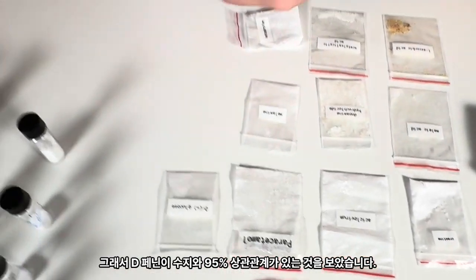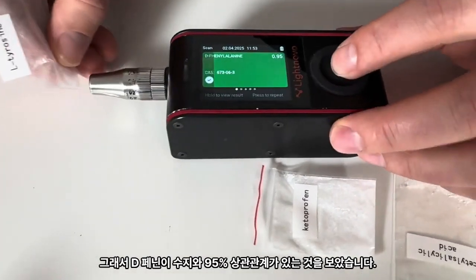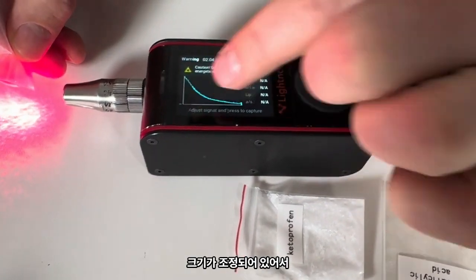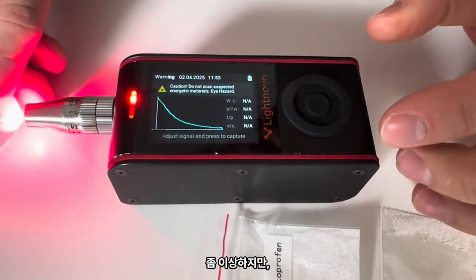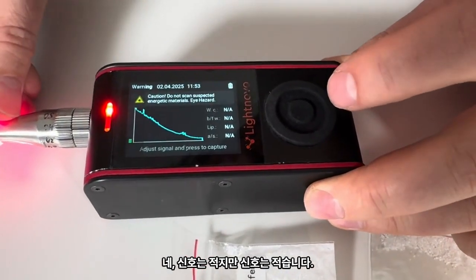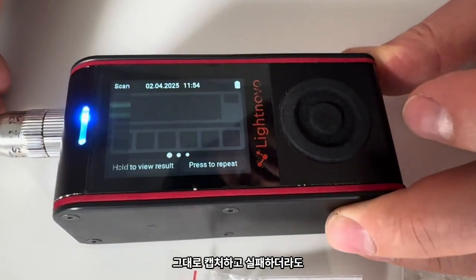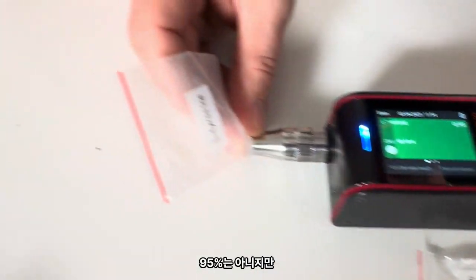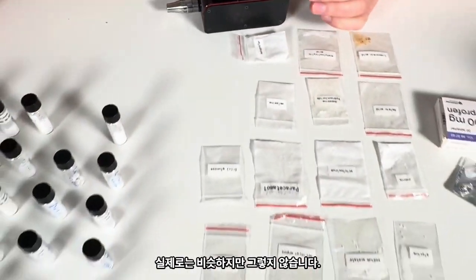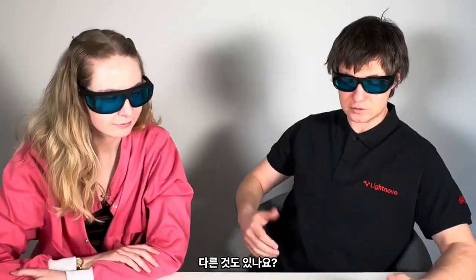Compare with L-tyrosine, yes? Let's see. Okay, turn on. We see the background. Signal intensity is very low. It's scaled, so that's why you see it kind of weird, but it's very okay. Yes, and signal is less, but let's capture it as it is, and nice. L-tyrosine, 95% as well, but actually, yeah, they are similar, but not for Raman. Something else.